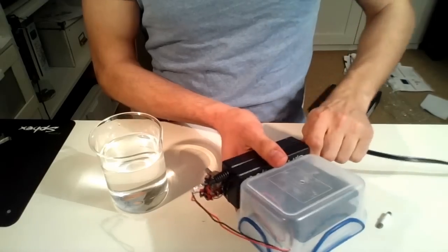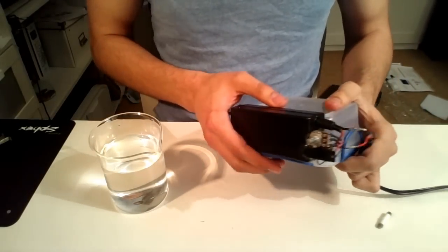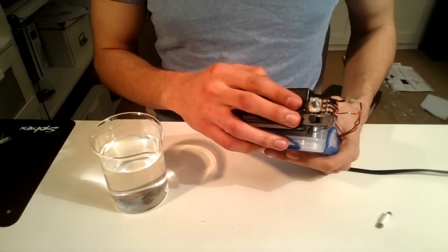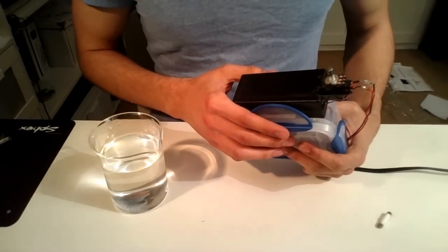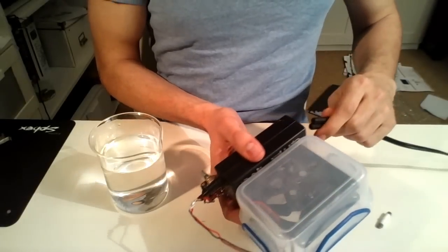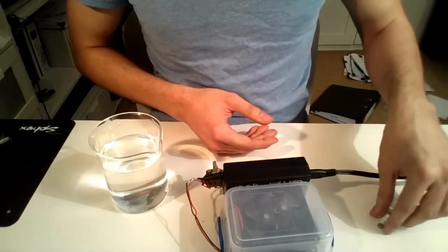Here I've got an old laptop charger, which laptop broke down, kept the charger just in case, and what do you know, it came in useful. And these two components are from an old steering wheel for my PC, which again doesn't work anymore, so I decided to take it apart and found some pretty cool components in there. Actually, these were the main components in there. Steering wheel was just a glorified light switch.